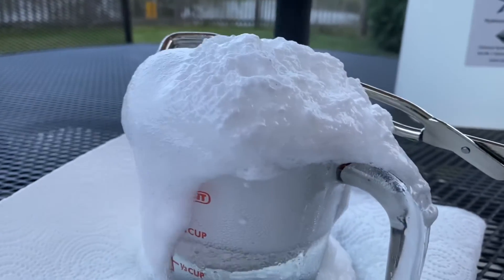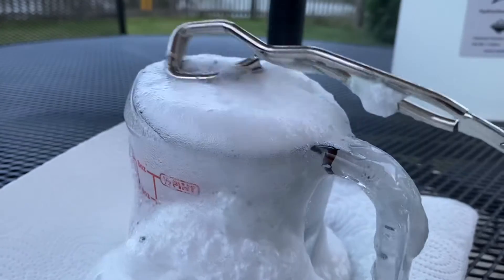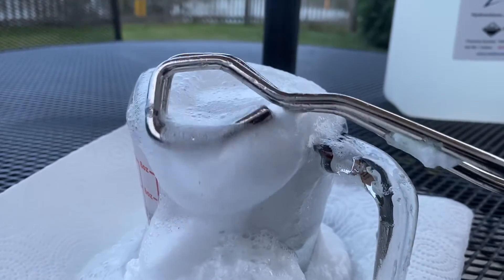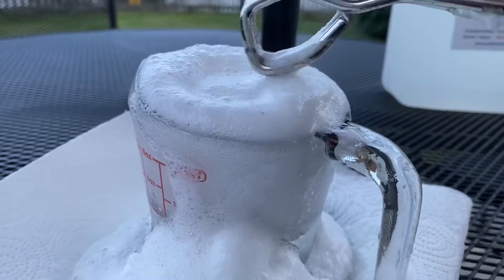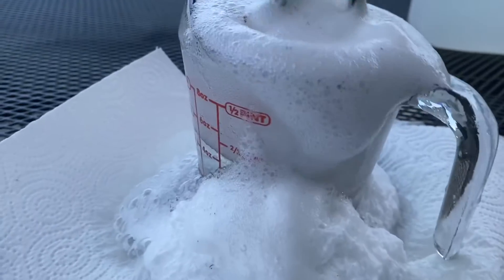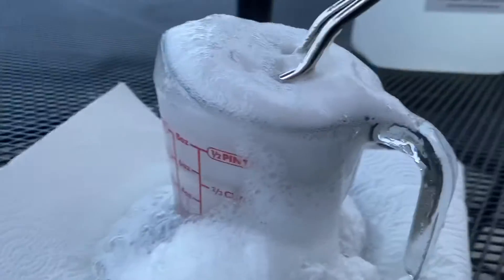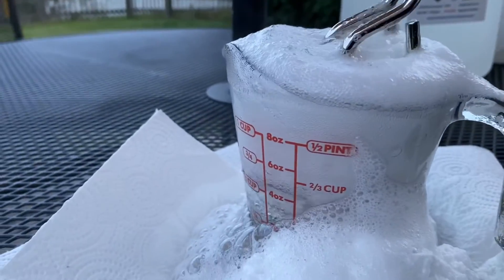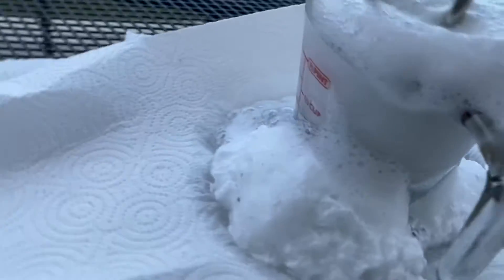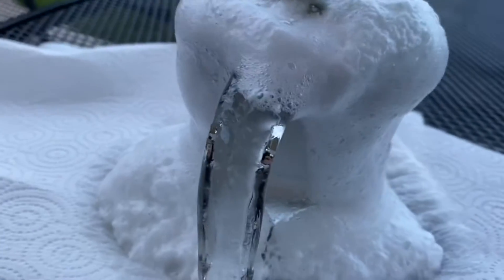Lots of effervescence on the top as all of that CO2 creates bubbles. And down below, you can see our eggshell is still dissolving in the hydrochloric acid.